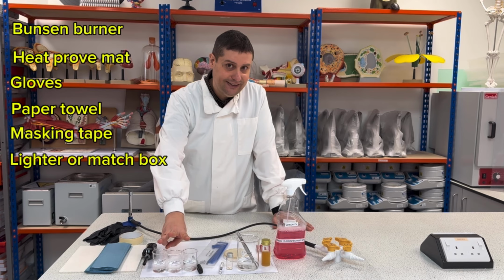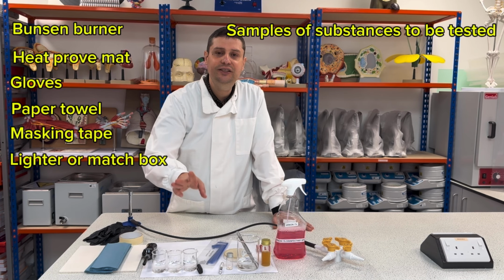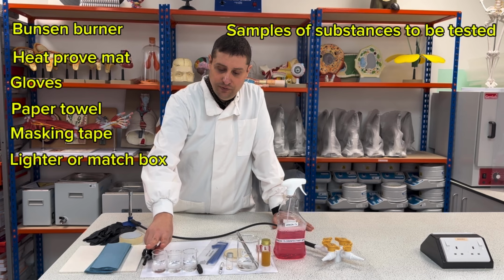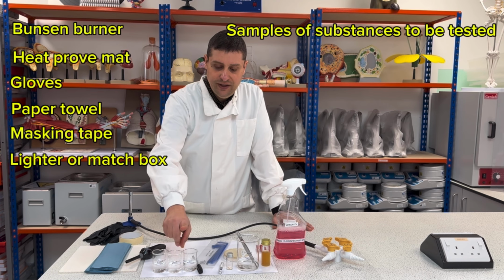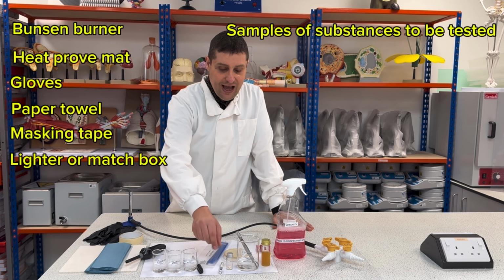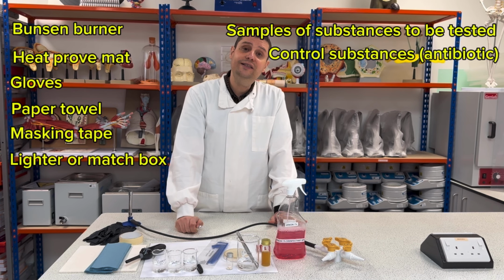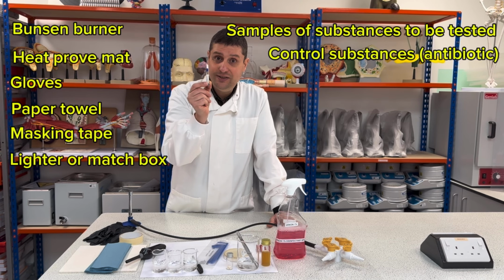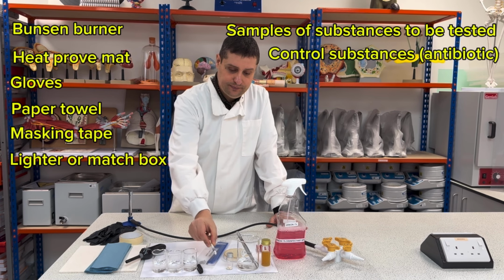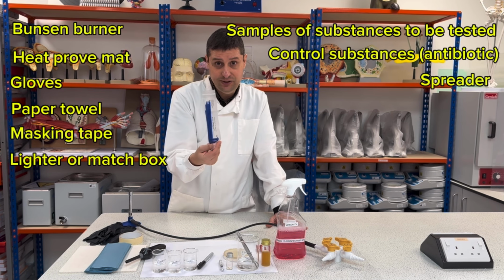I need at least 3 samples of substances I want to test the antibiotic effect. Okay, so for this lesson we choose vinegar, Dettol, and mouthwash. I also need my control, a substance that I know for sure has an antibiotic effect. So I have discs of penicillin here. I also have my spreader, okay, a plastic spreader.